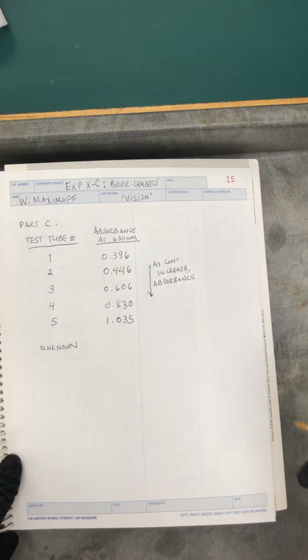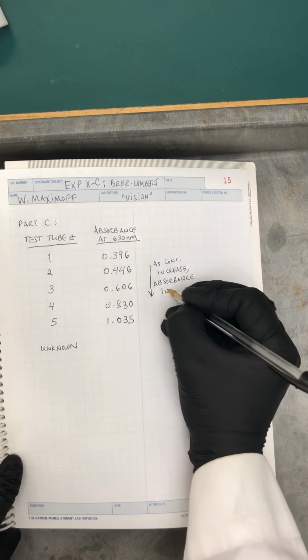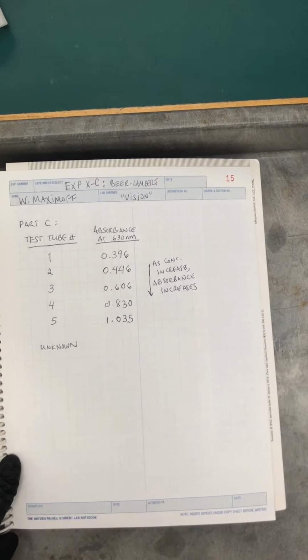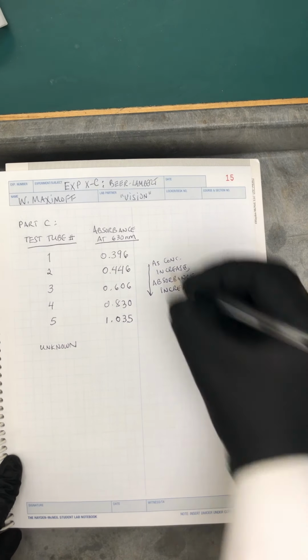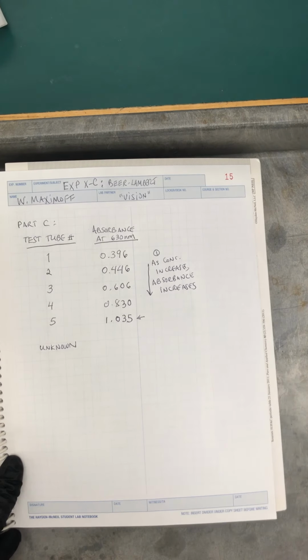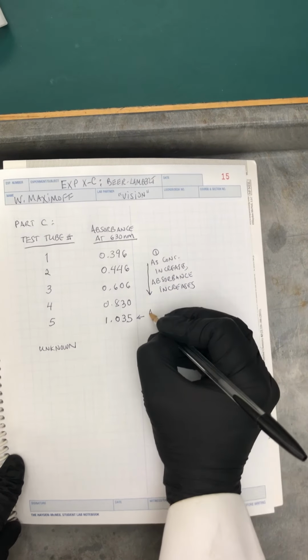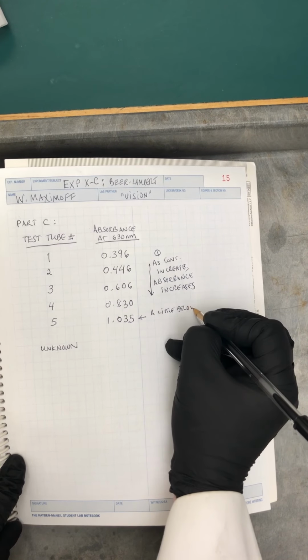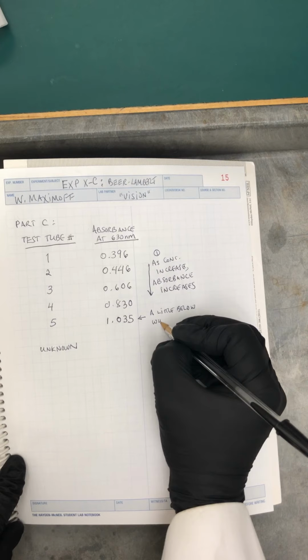If you don't, then something went wrong, or if you see some dips here or there, maybe your solutions were not done properly. The other thing that you notice is that this value here came out a little below what we obtained in the spectrum, right?